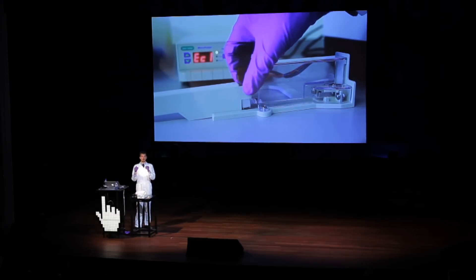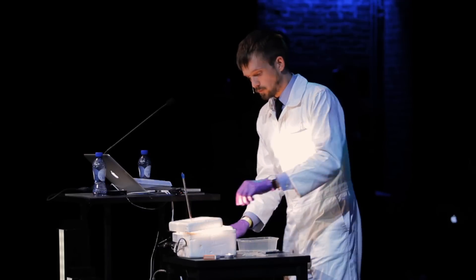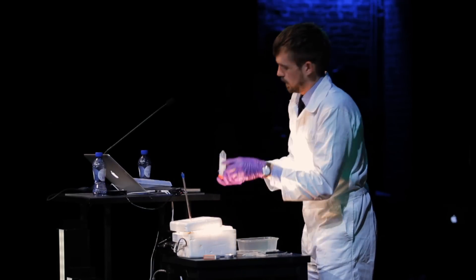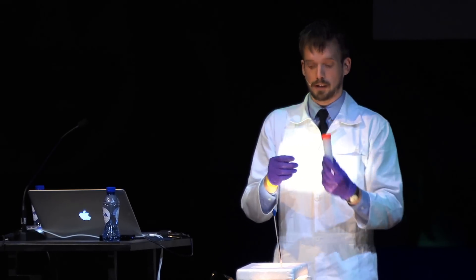And it basically opens up the cell boundaries by putting high voltage on it. So, here's one I did earlier. So these now are the bacterial cells with the DNA inside, because I've electroporated it earlier.